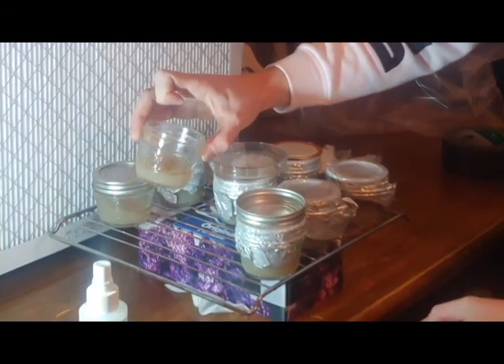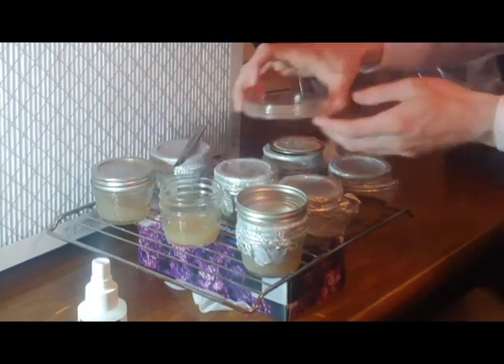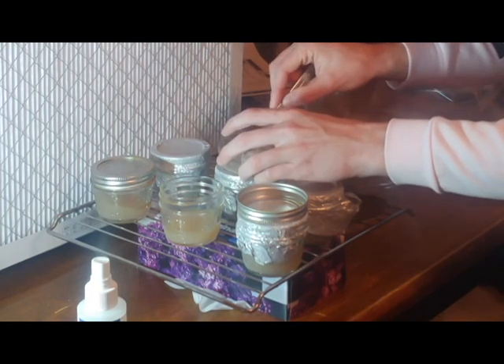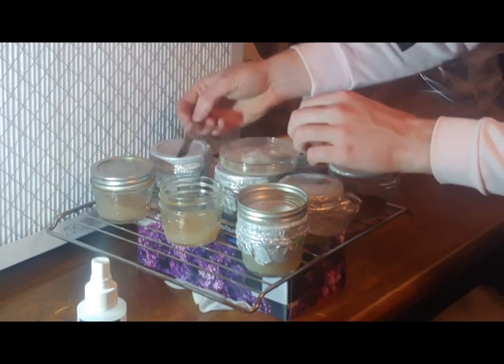Here I'm just pouring off water from the petri dish — it's a mistake that was made when I was doing the no-pour technique. As you can see, my sterile practice isn't the best, but I will learn for future projects.